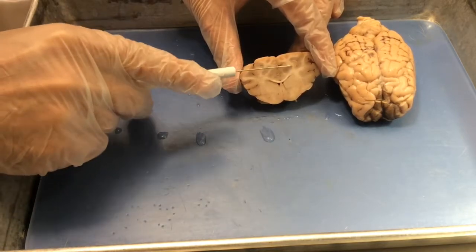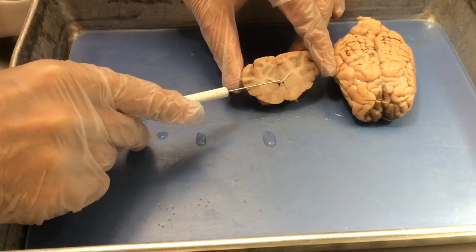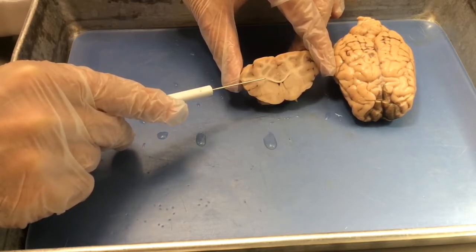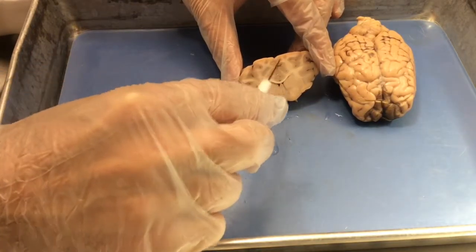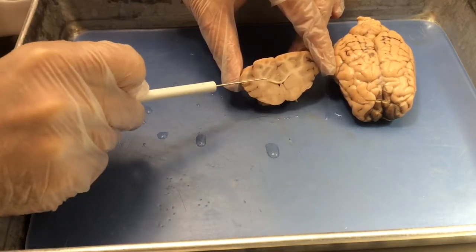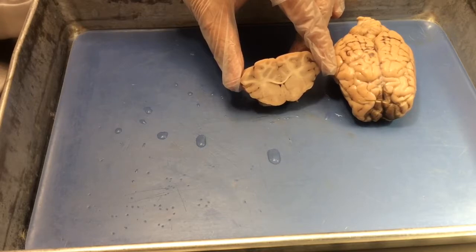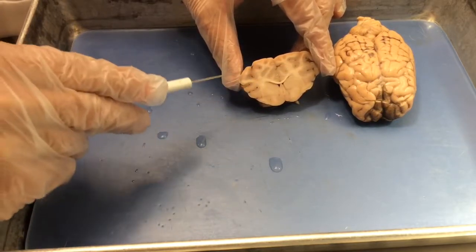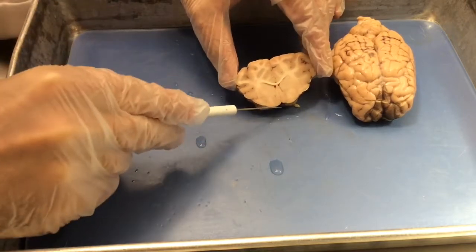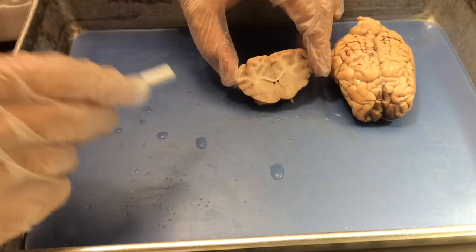The dividing line between the cerebral cortex and the subcortex is a very high contrast, very vivid strip of white matter that runs across the midline of the brain. That structure is called the corpus callosum. In an earlier video, when we made sagittal dissections, we learned to identify the corpus callosum. The corpus callosum connects areas of the left hemisphere with areas of the right hemisphere. So everything ventral to the corpus callosum is pretty much subcortical forebrain.